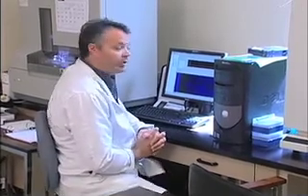rare and endangered species. The device I have behind me is one of the most powerful machines we have in the room. It's an automated DNA sequencer. What we use it for is for sequencing DNA sequences. We also use it for studying microsatellites. Microsatellites are short, repetitive bits of DNA that are very variable in populations, so we can use them for studying one population to another.